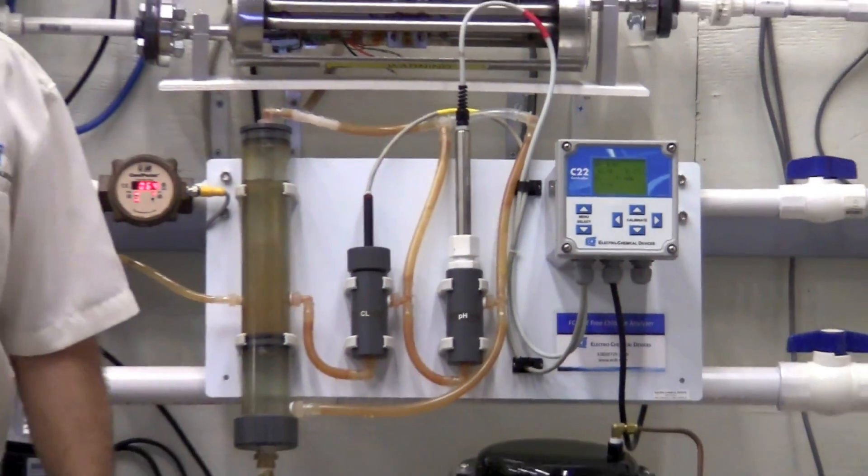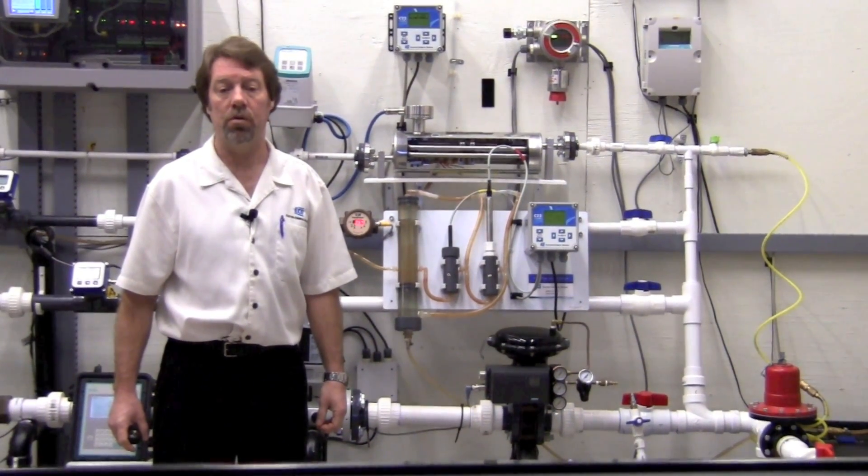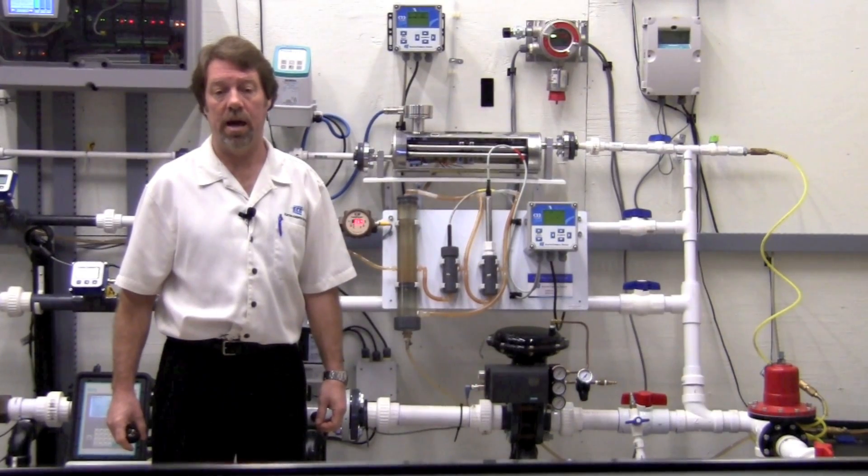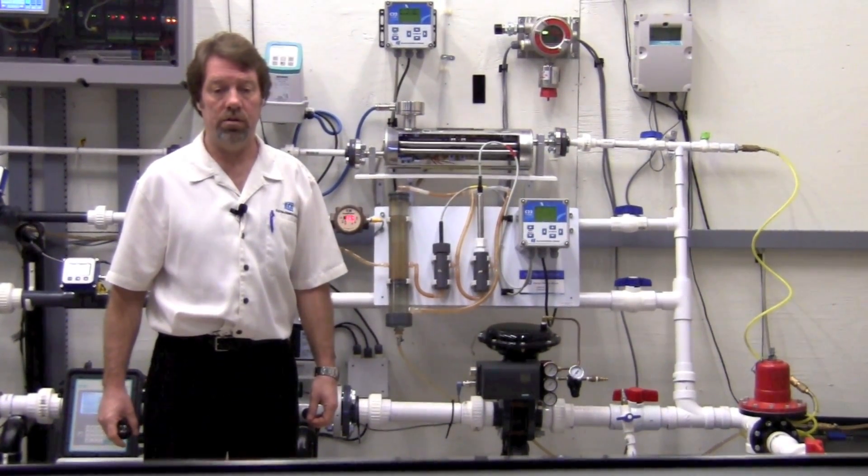Once you've got the wiring all connected, apply power to the system and allow the process to flow through the system for 60 to 90 minutes to polarize the chlorine sensor. The system is now ready to use.